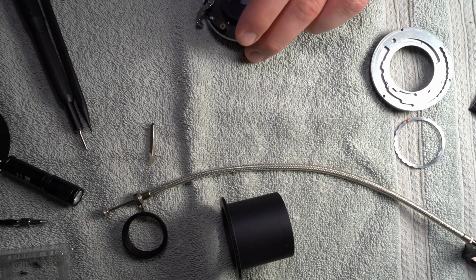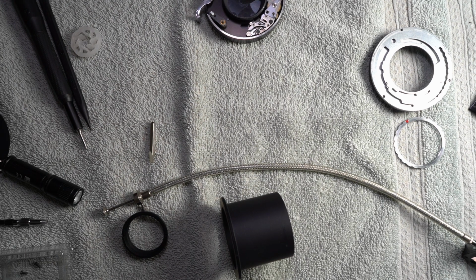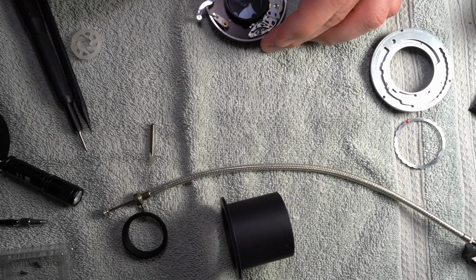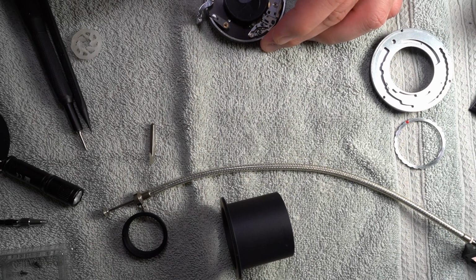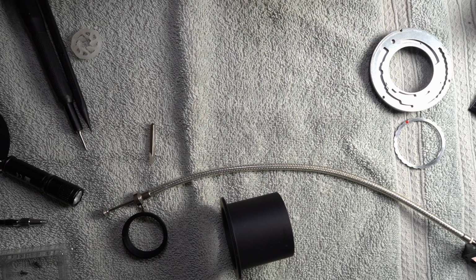Okay, I think that's pretty good. Let me get this other chunk of paper towel here and clean my tweezers off, and then clean off the excess off of these things because I don't want excess grease where I can avoid it. I also don't really want these fibers in here, so I'm going to be really basic about this.